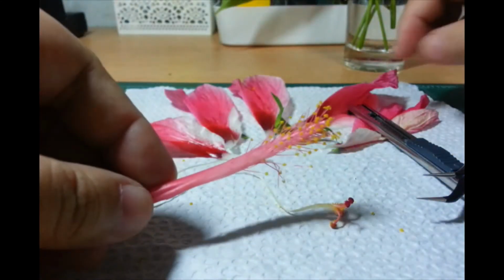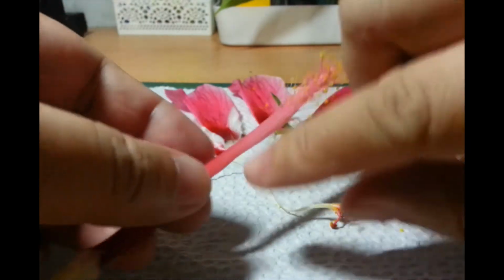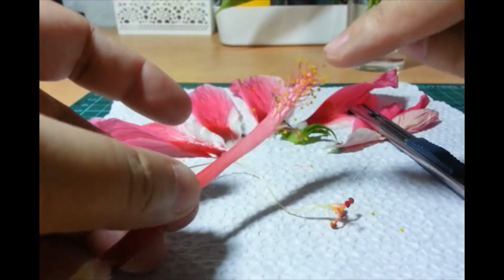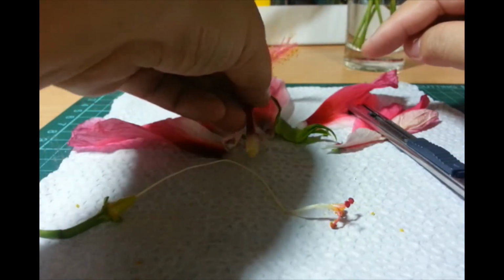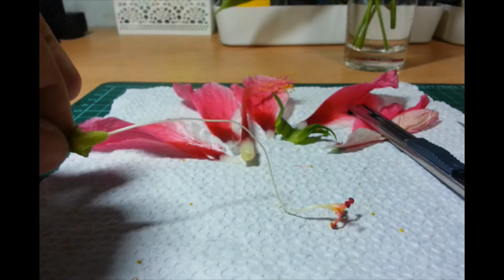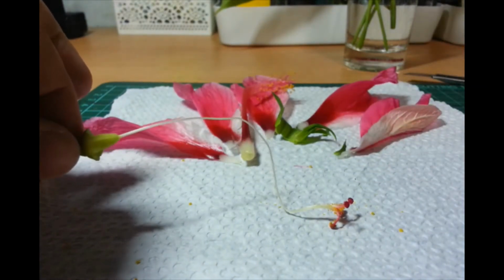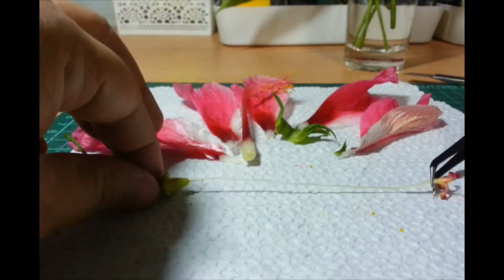With the stamens intact. Well, except for one that I removed earlier. So, ito yung stalk ng flower na may male parts with the stamens there. I'll just leave it here. And we'll take a closer look at the female part. Laki niya. I don't know if I can fit it sa view.